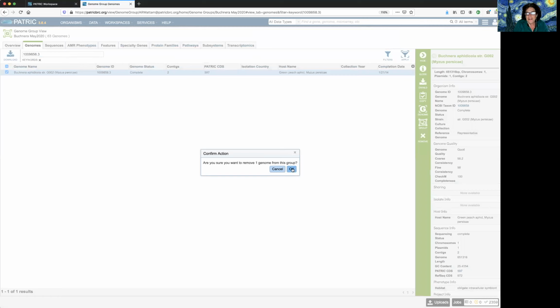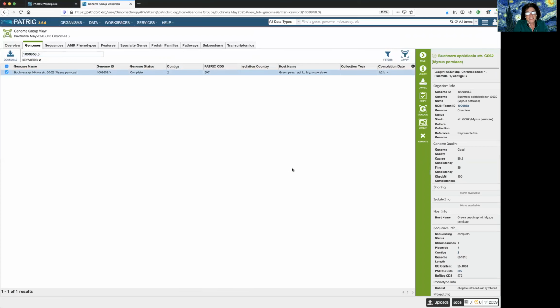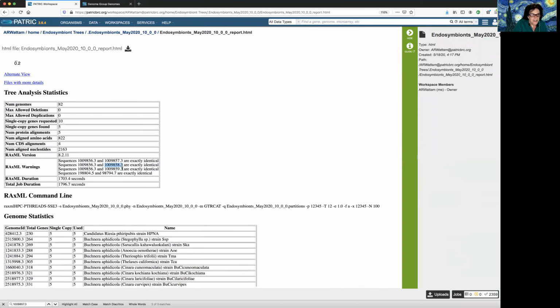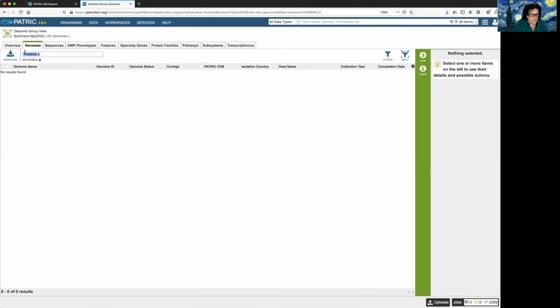Oh, this time, remember last time how I saved the group? I've been adjusting this current group. Oh well. That's why I like to save it and rename it so I don't do my original one. But I was so excited about creating the perfect group that I forgot about that. But, you know, in for a penny, in for a pound, let's get rid of even more. So this guy, seeing as we're getting rid of him, we're just going full force.